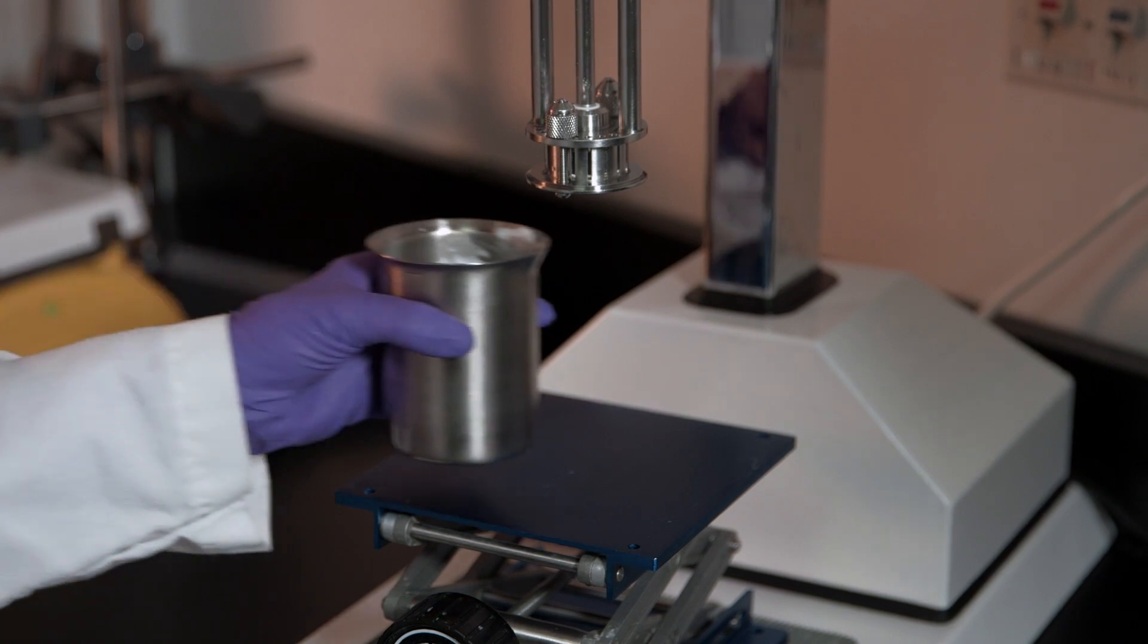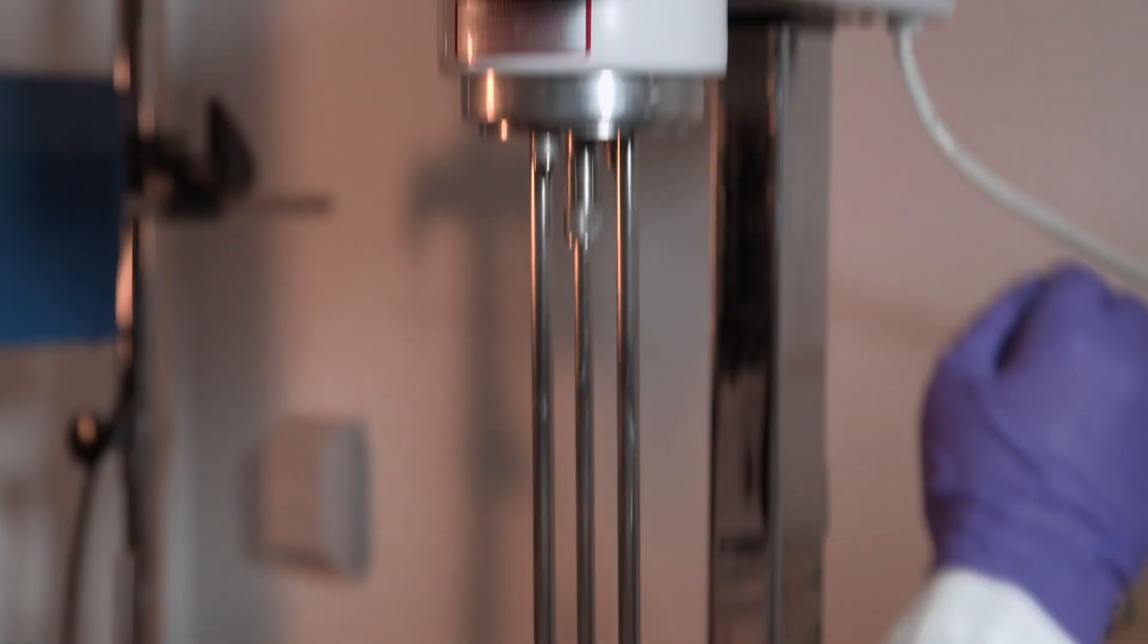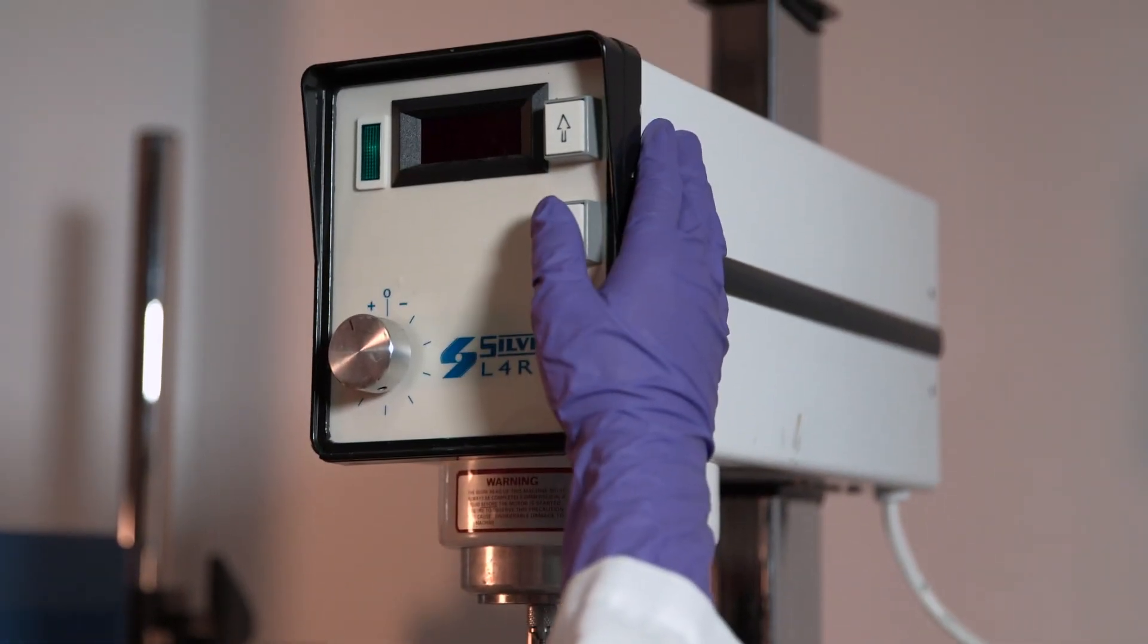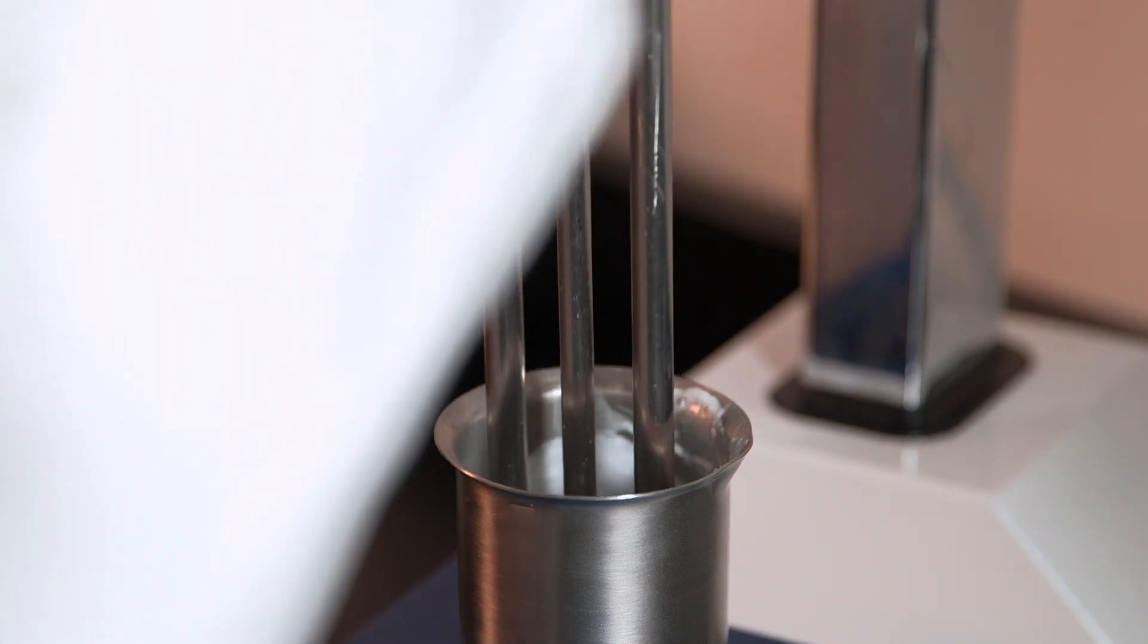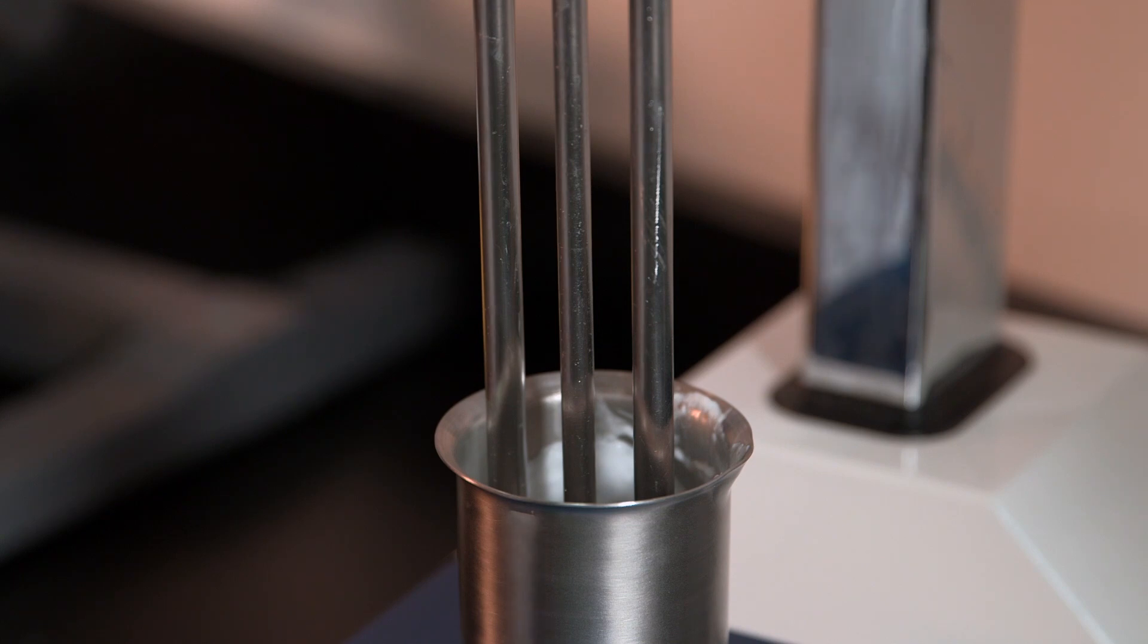Interestingly, this moderate shear is sufficient to form the emulsion. However, we continue to shear the formulation using homogenization to reduce droplet size and likely improve the stability of the formulation.